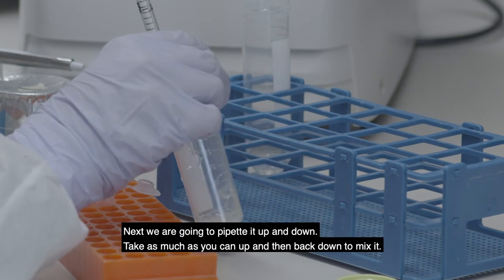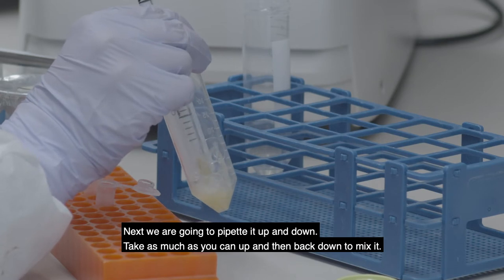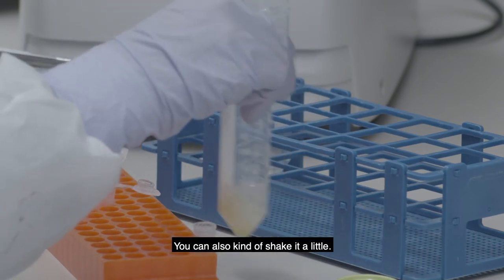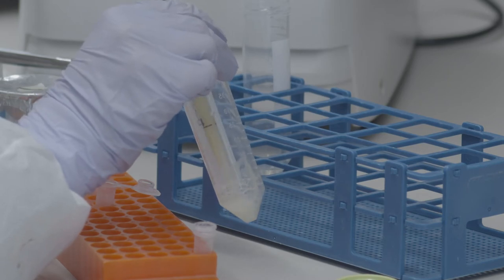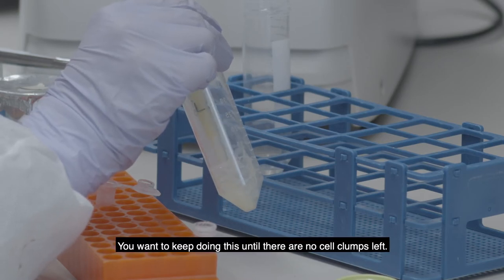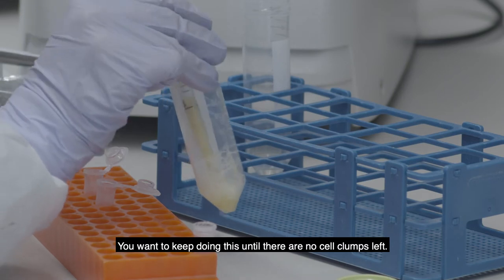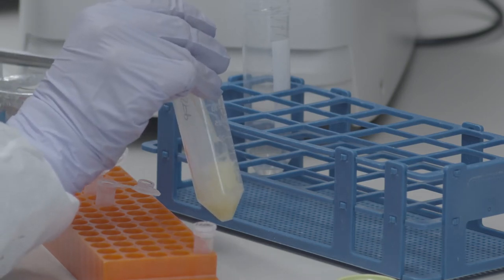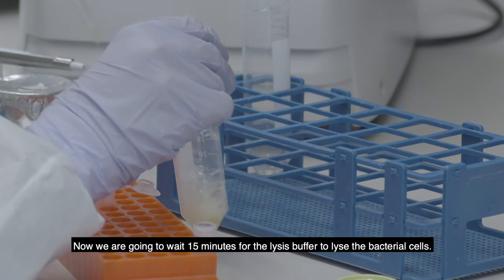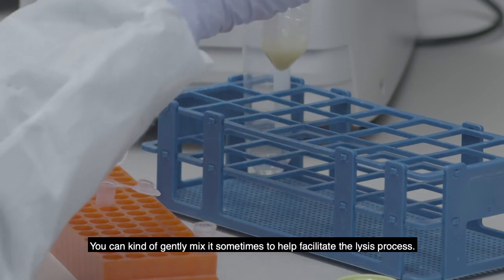Next we're going to pipette it up and down — just take as much as you can up and back down to mix it. You can also shake it a little. You just want to keep doing this until there are no cell clumps left. Now we're going to wait 15 minutes for the lysis buffer to lyse the bacterial cells, and you can gently mix it sometimes to help facilitate the lysis process.